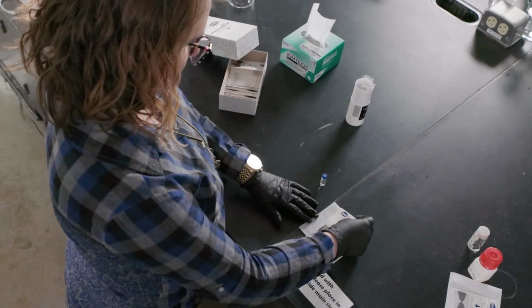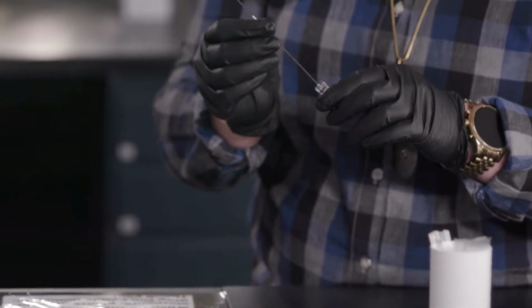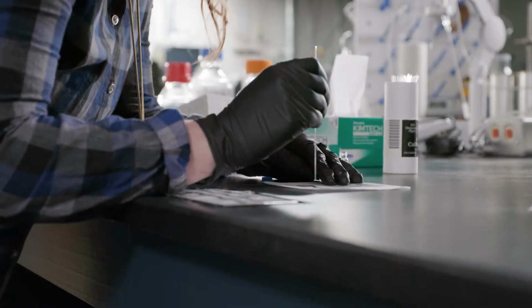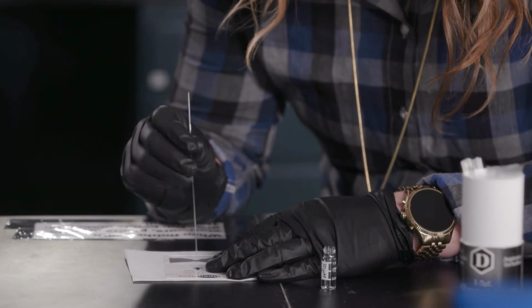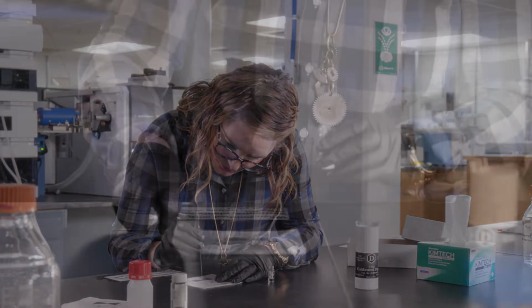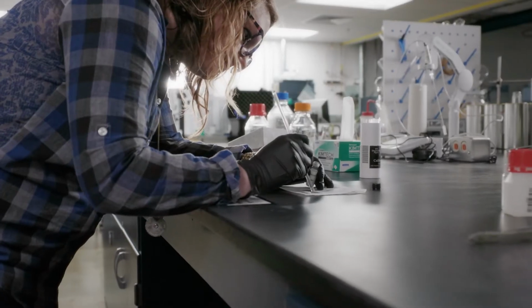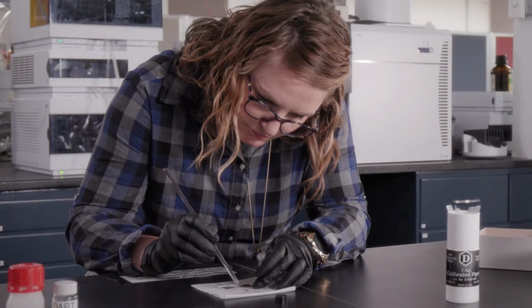Place an open spot card on a clean Kim wipe. Then, if your sample is soluble, use a capillary pipette to draw up some of your sample, and tap the capillary pipette on the middle of the grid to coat the grid with your sample. Let your sample air dry. If your sample is insoluble, you can use the tip of a glass rod to place some of your powdered sample on the open spot card grid.